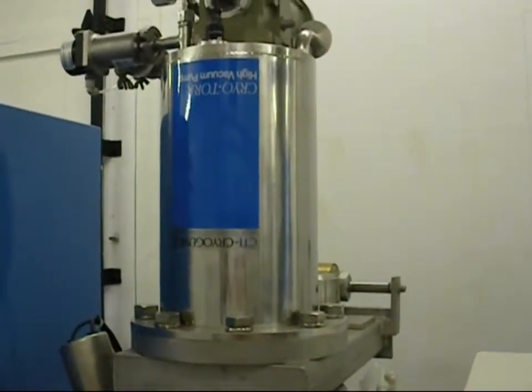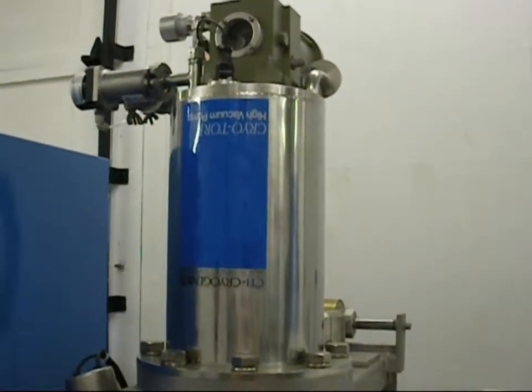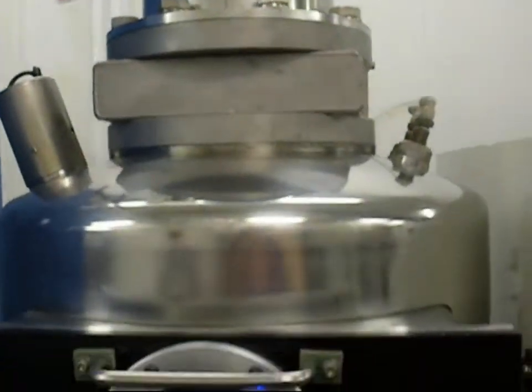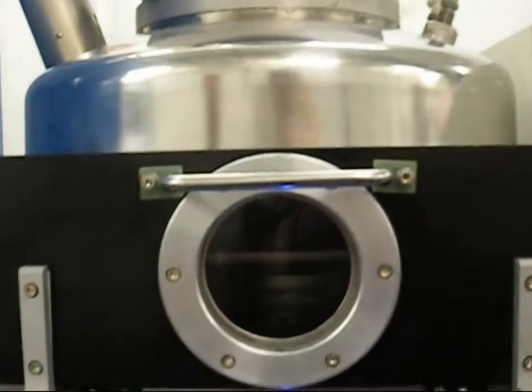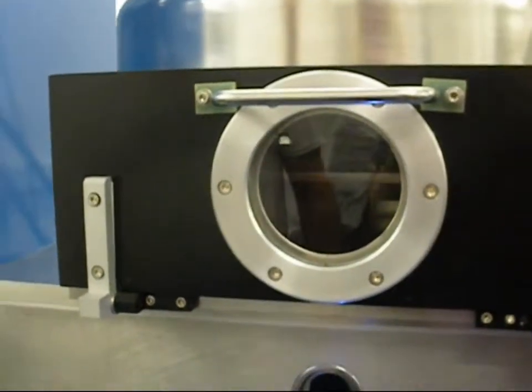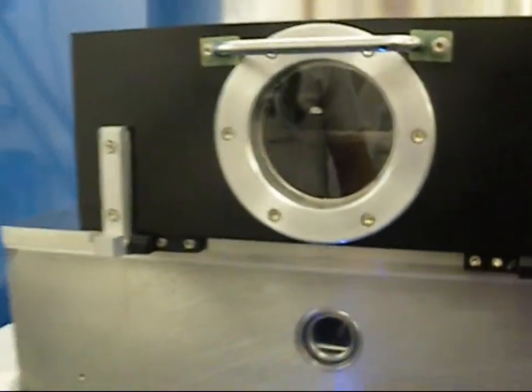The load lock chamber roughing valve will open and the 27 CFM direct drive mechanical pump will start to rough vac pump the load lock chamber until a pre-programmed set point is met on the Granville Phillips 307 ionization gauge controller.